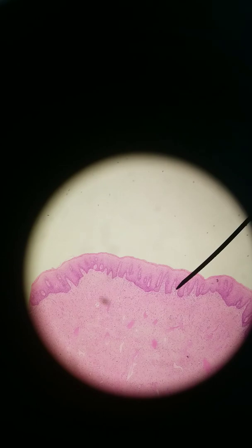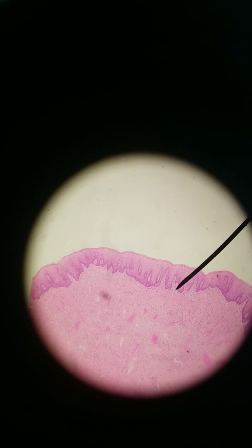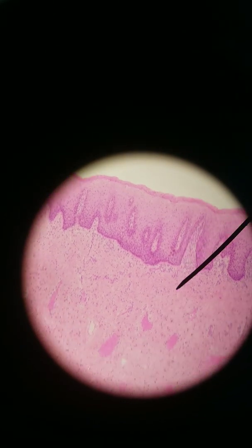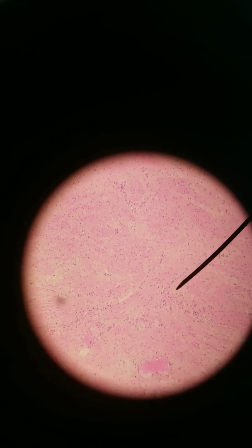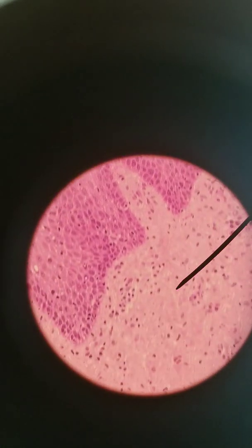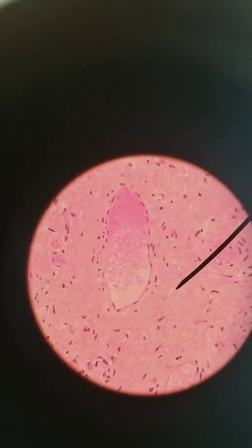Once we get past the cervix, we get to the vagina, and the vagina is made of non-keratinized stratified squamous epithelium. There is a muscular layer, and that muscular layer is continuous with the myometrium of the uterus. You can see the stratified squamous here, non-keratinized, then the muscular layer. At 100x you can see the stratified squamous pretty clearly, and then these darker pink parts — we're getting to more and more muscle. Stratified squamous very ordered, then submucosa, and getting to more and more muscle with a blood vessel visible.